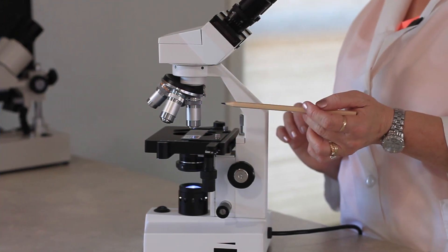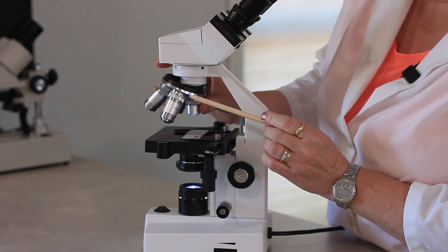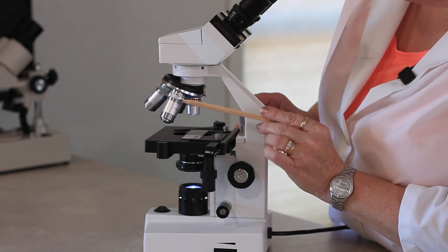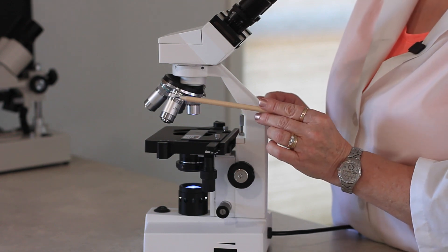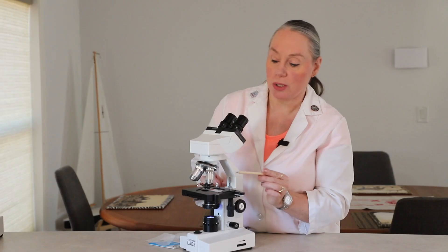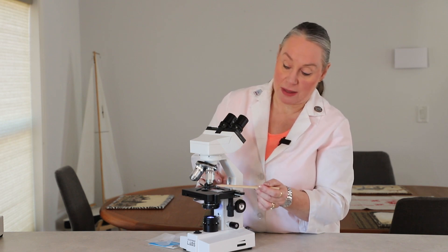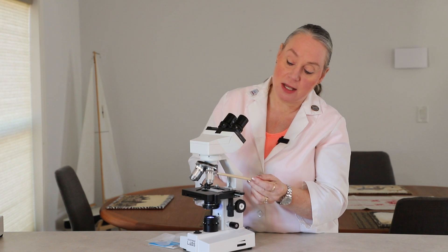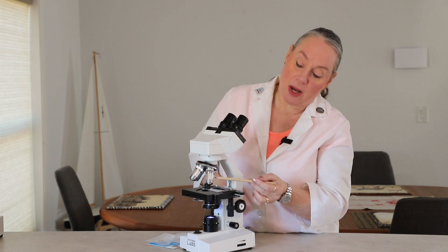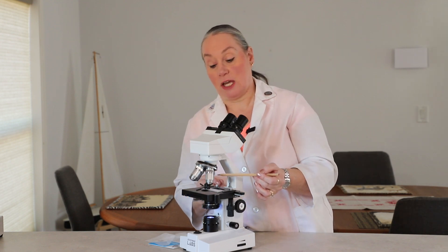Now if you have an advanced microscope, you might have this white ring objective. This is 100 times magnification, but it is a special oil immersion lens that you will not use a slide cover with — it actually goes in the oil on the lens. And so 100 times 10 is going to be 1000 times magnification.